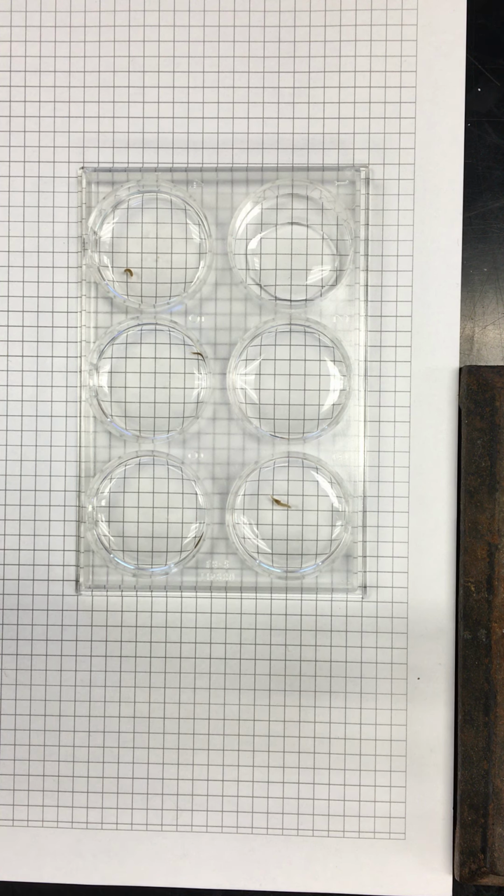And do we have the free yet? No. Got it. So there's a milliliter of each of these. The antagonist won't be diluted at all. Well, we want to get it to a concentration of 100 micromolar in your final. So we wanted 100 micromolar in 2 milliliters. Yep. Okay. And 2 milliliters total. What is the concentration of it now?